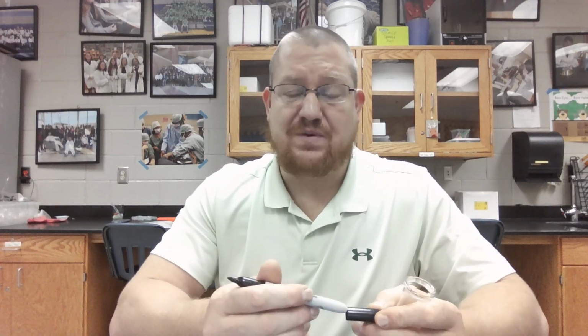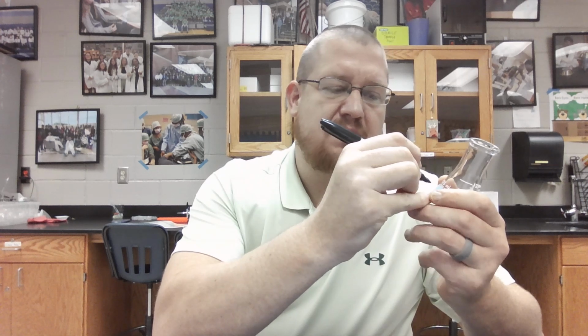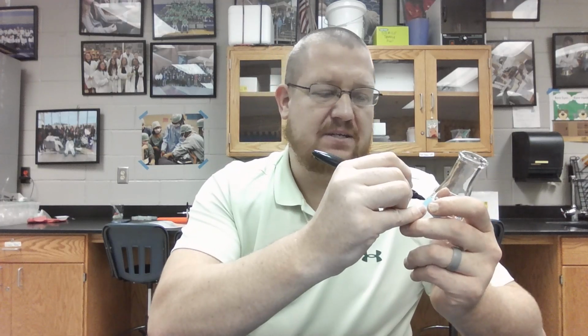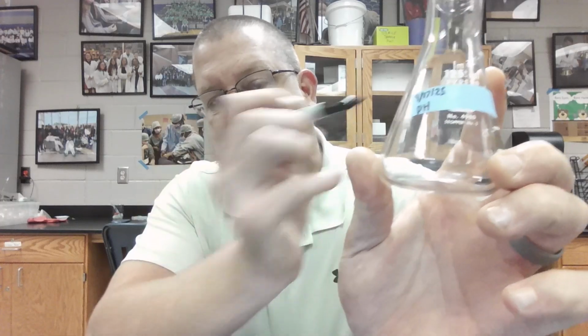So first I'm going to start with the date. Today's date is September 17th. So I will label the date on here. And then the next thing is the identity of the person who made the solution, and that is me. So I'll put my initials on this. Here you can see the date at the top and the initials of the person who made it at the bottom.